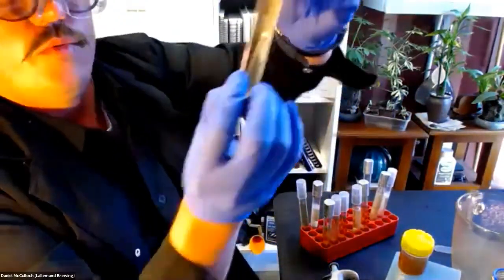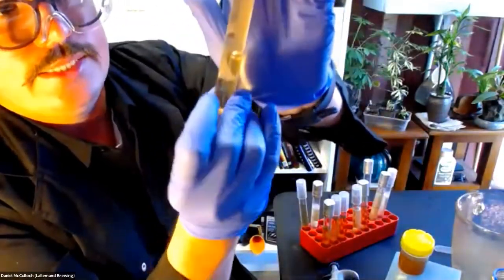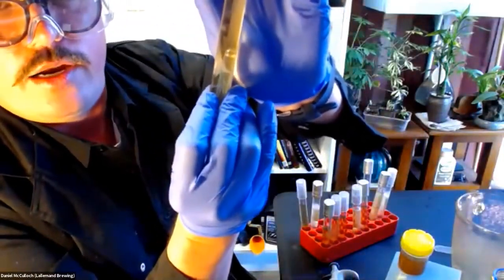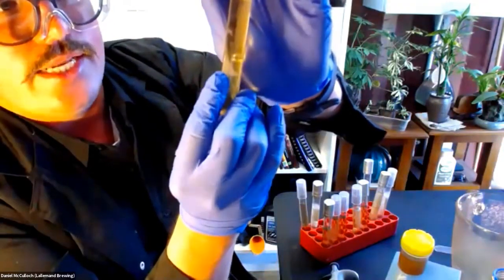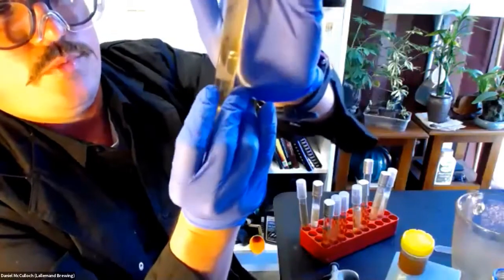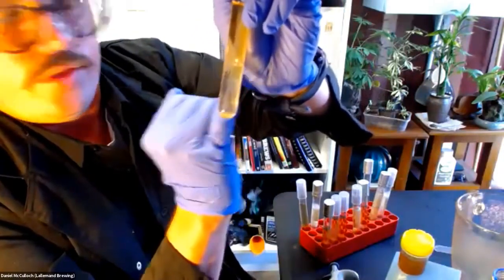We can see here, we've got a small bubble that is bubbling away, as I've actually poured a higher inoculated concentration of the Belle Saison into this, and it's slowly filling up the tube. And the CO2 bubble is being formed there. So we know that something's happening.